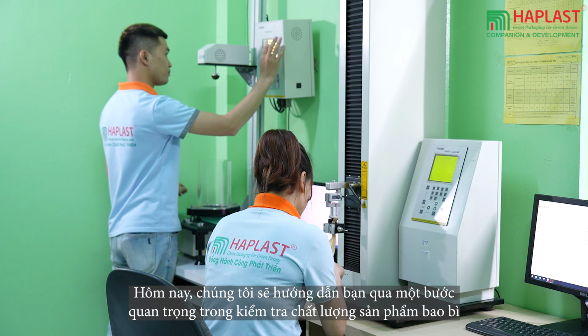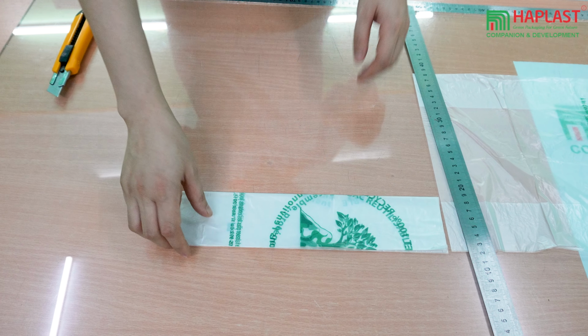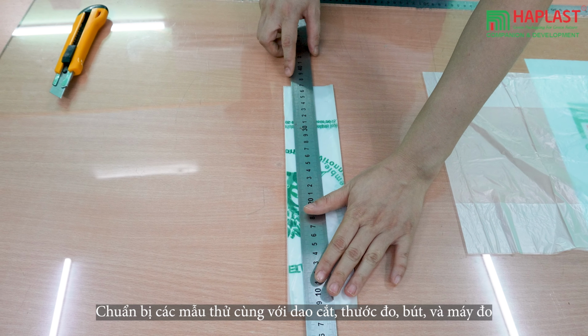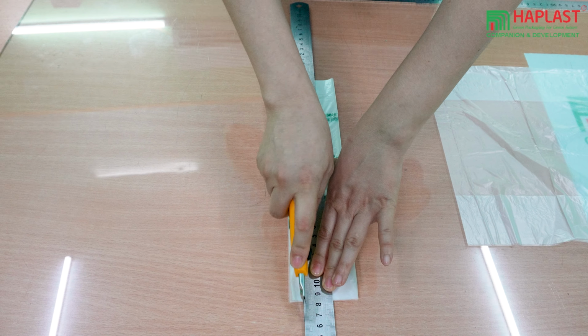Today we'll guide you through an important step in packaging product quality testing, tensile testing. Step 1. Preparation. Get the test samples ready along with a cutter, ruler, pen, and the testing machine. Step 2. Conducting the test.